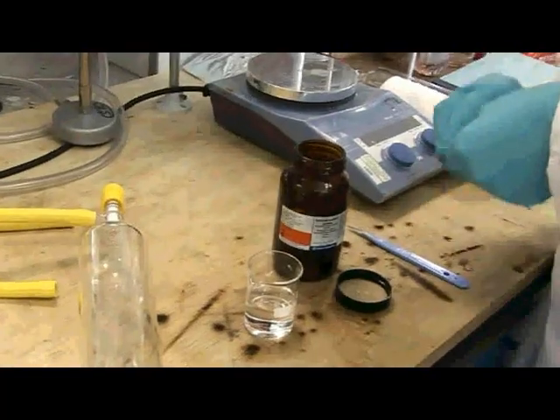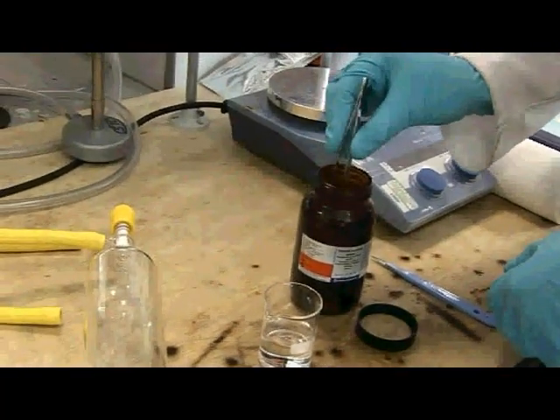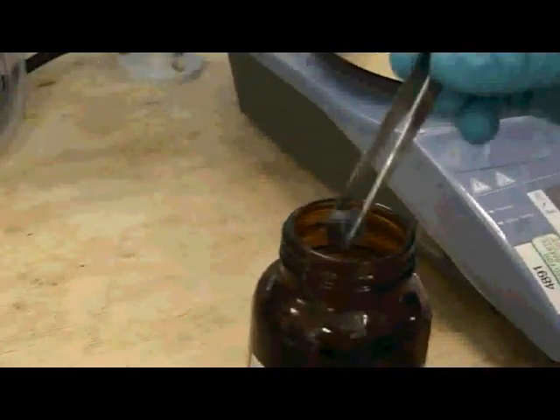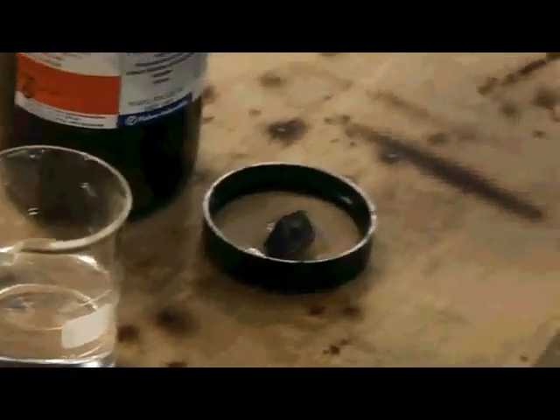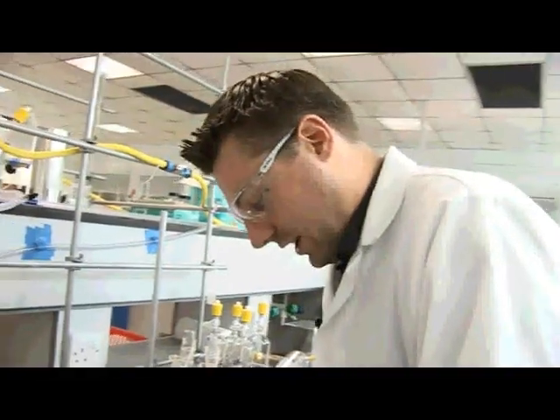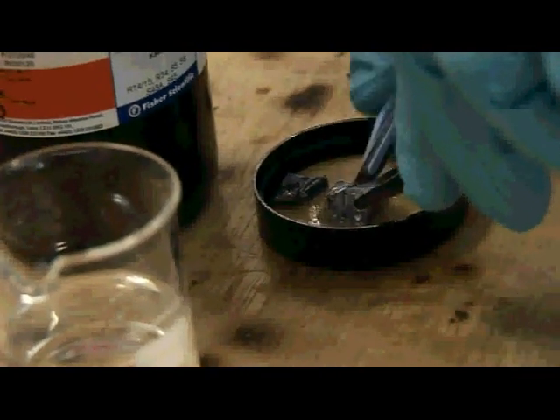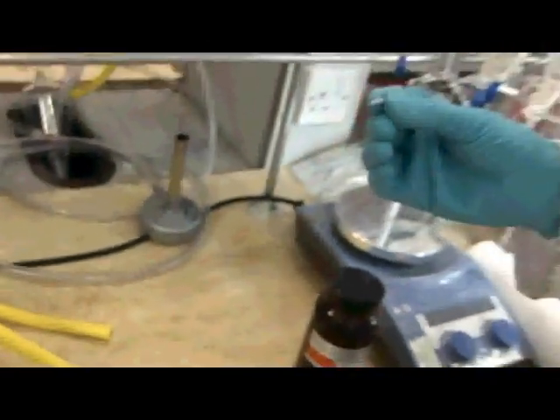Today I'm going to show you how to make a potassium mirror. We'll just fish out a nice little bit of potassium — it's stored under mineral oil because it reacts with water over time. It's quite malleable stuff, a little bit like cutting blue tack, quite soft. And you can start to see it's starting to go off a little bit already, tarnishing a wee bit.